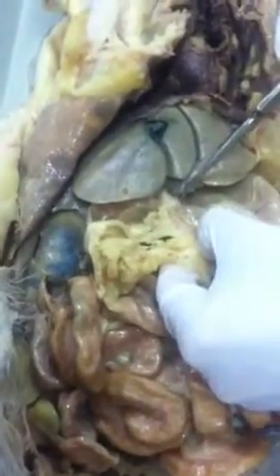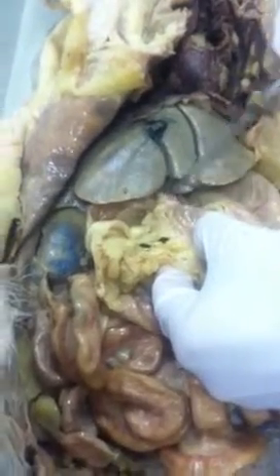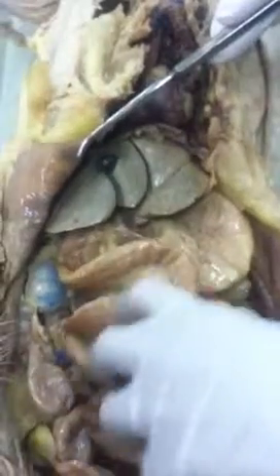Right. So if I have a mark right here between this junction, I want the sphincter that's right here, which is what? Pyloric sphincter, right. So duodenum would be this part here. And what's the next section? Jejunum. So the middle section is the jejunum, all the folds here.